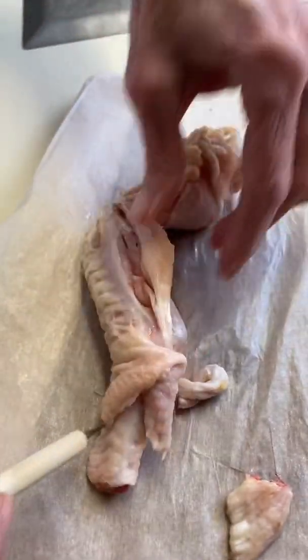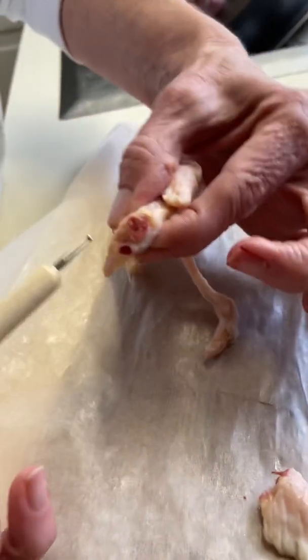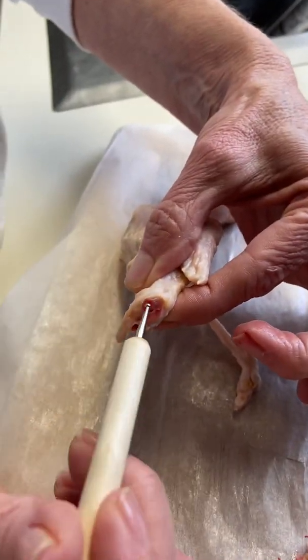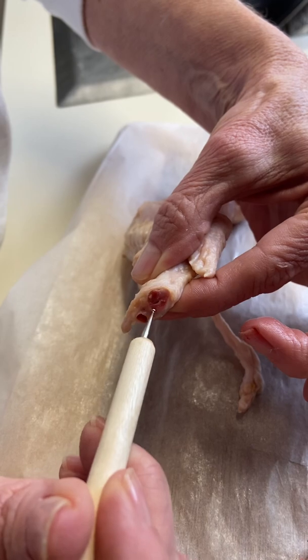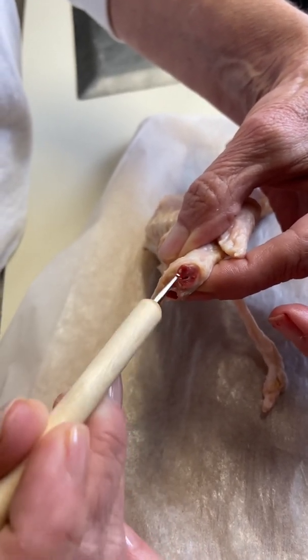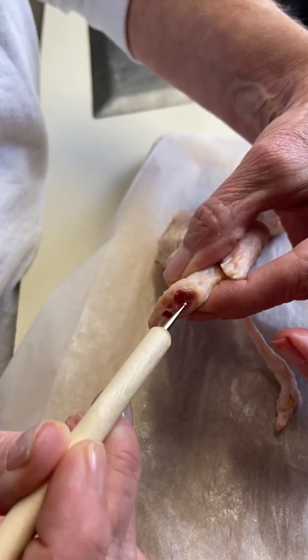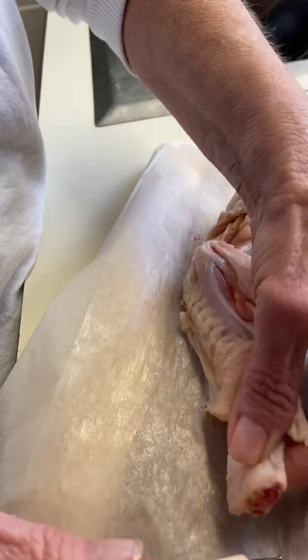For the bone marrow, I took the liberty of cutting the tip off of my wing so that I could bring it up and get to it. You'll see that the bone marrow is in the hollow portion of the bone here, and it's very spongy-like, and sometimes you can just pull that out. This here, it's a little hardened. But anyway, this is our bone marrow here, the red bone marrow that we're looking at there.